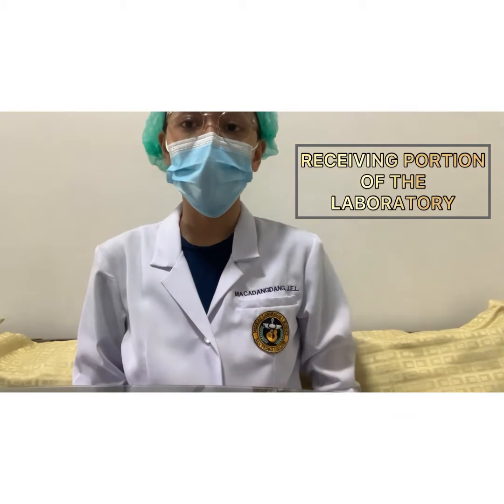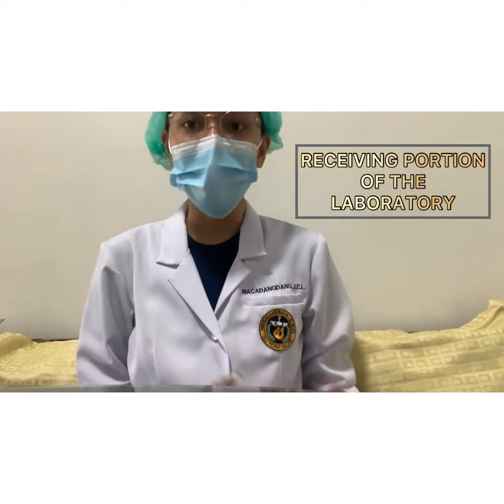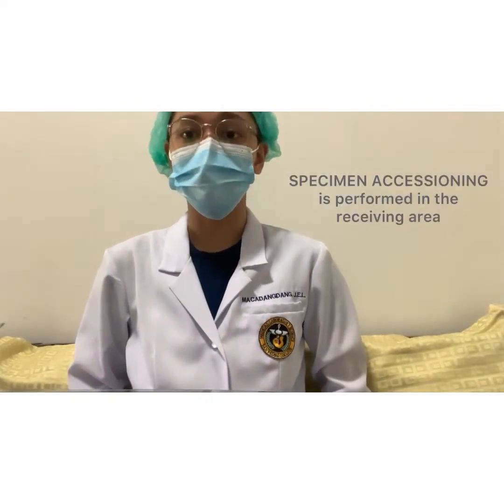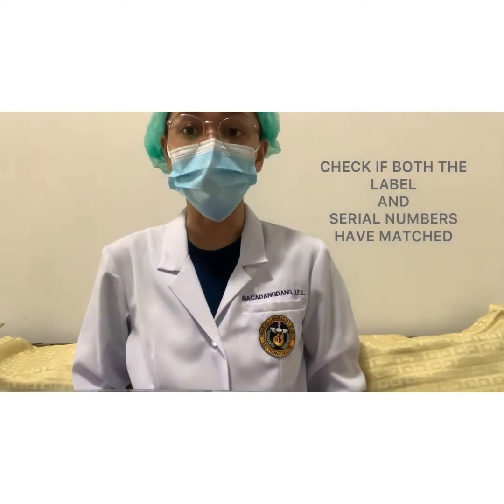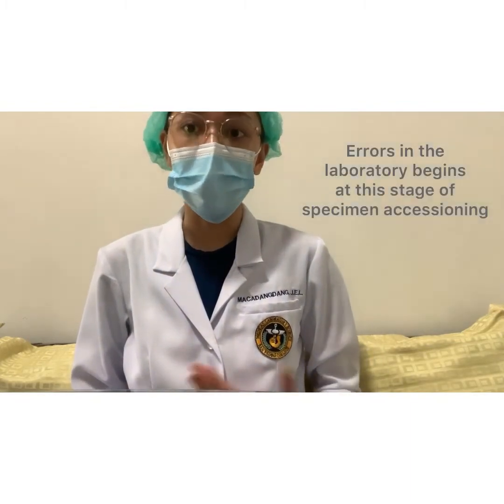This is where we receive the samples from the patient, and this is where we check the labels as well as the request form. Take note that specimen accessioning is performed in the receiving area. It is important that we check that both the label and the serial numbers match. Request forms are checked properly because this is where most of the errors in the laboratory would begin. Serial numbers are provided in this stage.